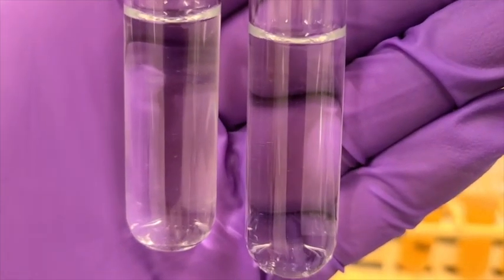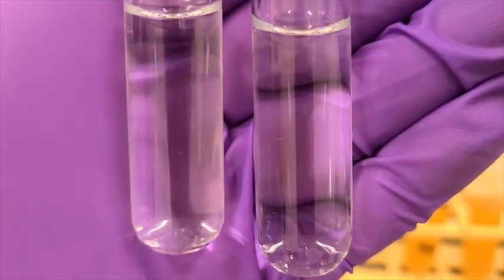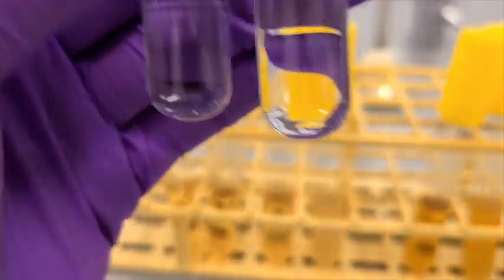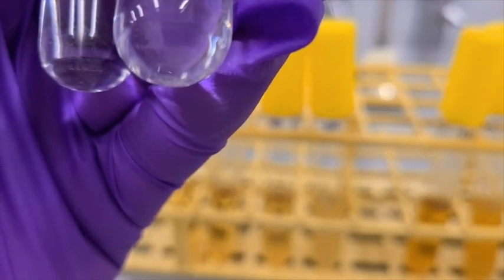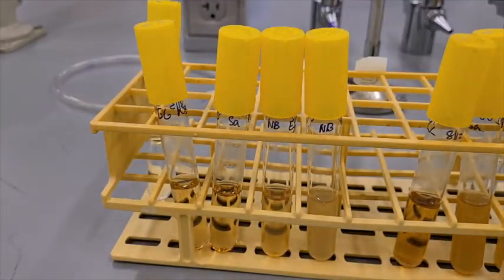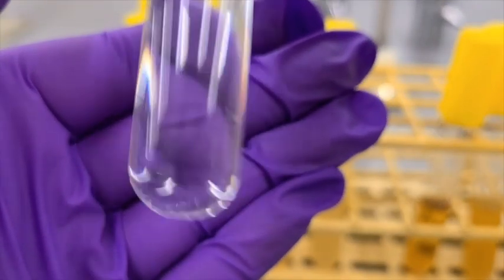And then finally we have our Staph aureus on the right and our control tube of glucose salts on the left. Initially there is no turbidity in the Staph aureus tube, so there's no growth. However, there is a bit of sediment that you can kind of see there. If I mix it up a little, you can see them slowly drift back down.